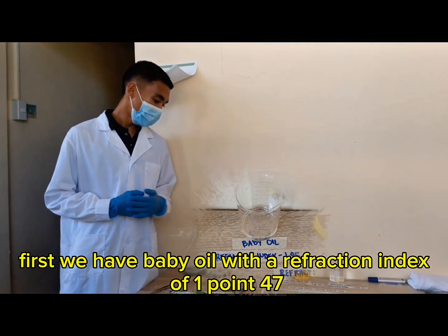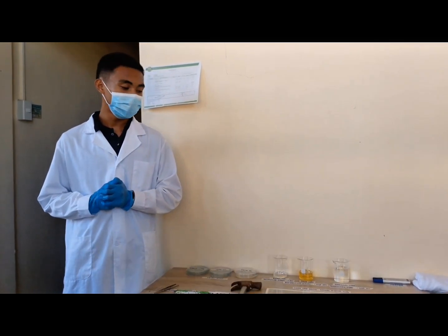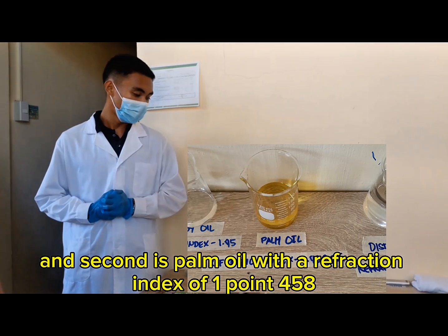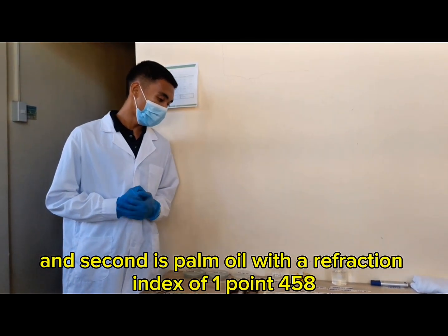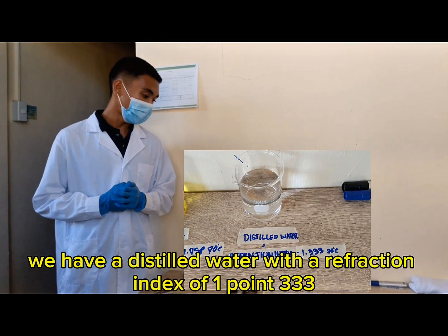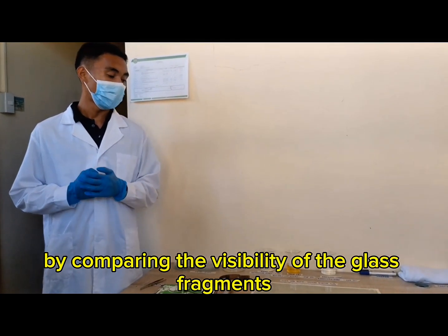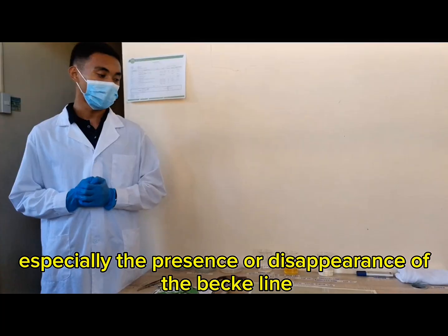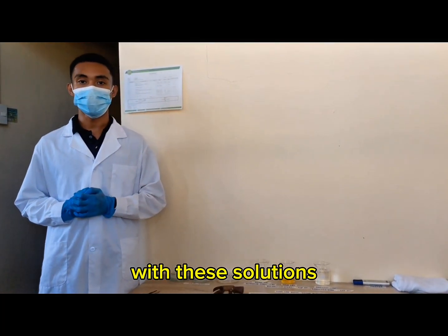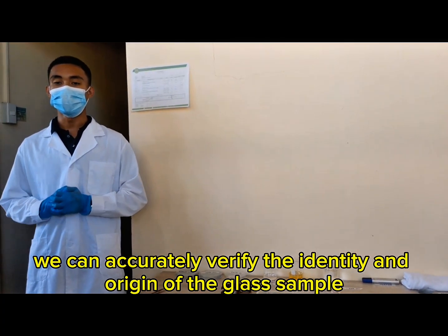First, we have baby oil with a refractive index of 1.47, and second is palm oil with a refractive index of 1.458, and lastly, we have distilled water with a refractive index of 1.333. By comparing the visibility of the glass fragments, especially the presence or disappearance of the Becke line with these solutions, we can accurately verify the identity and origin of the glass sample.